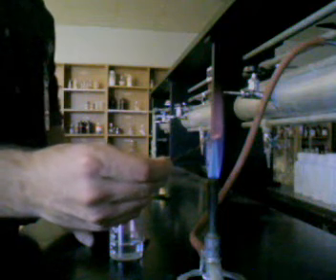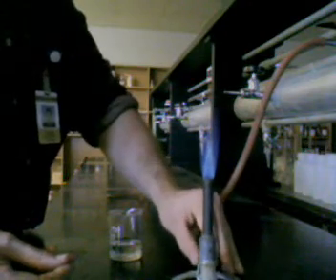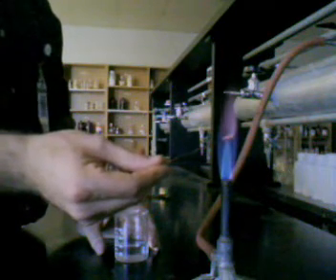And as the flame heats up, you see a change in color. Here that color change was violet. I know that was a little difficult to see. Let's try that again. Here we have a violet flame. Now what a violet flame does, that indicates that there's potassium in this solution. So this is one example. And there are many other ways to perform this test.